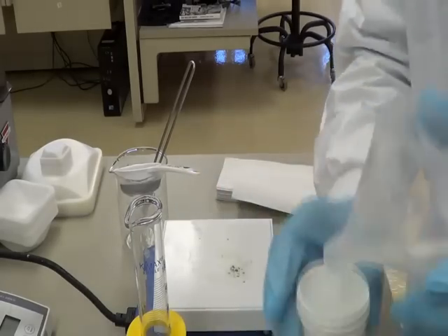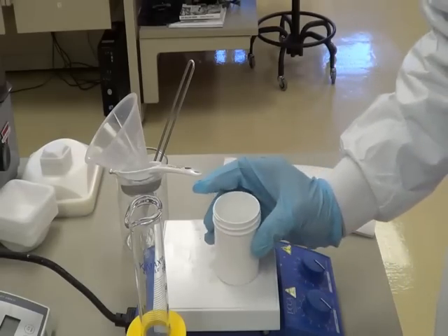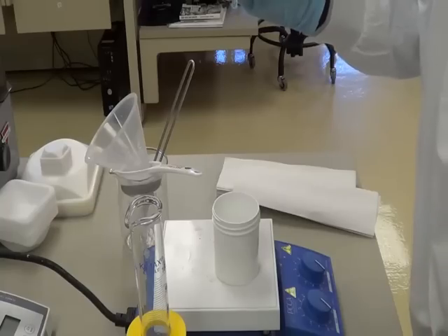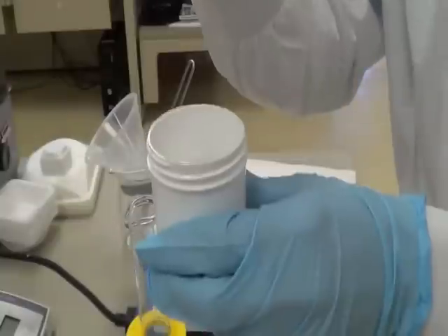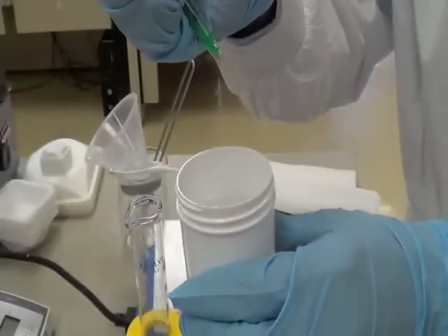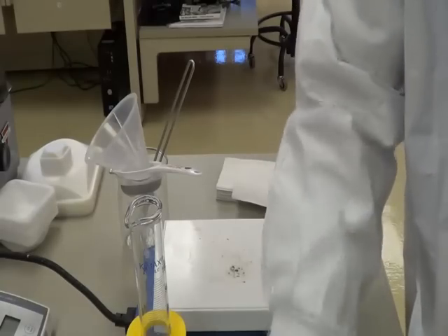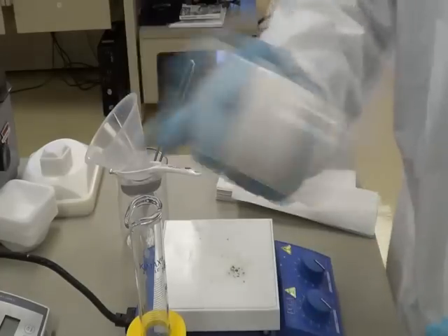So now we have 100 ml of carbomer solution. The next step is I am going to add trolamine — just three drops. Carefully use three drops: one, two, and three. Close this and just shake it.